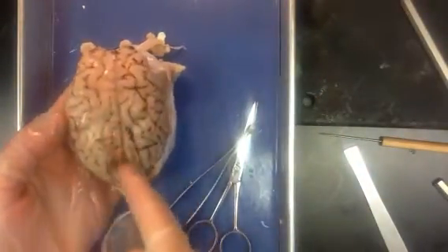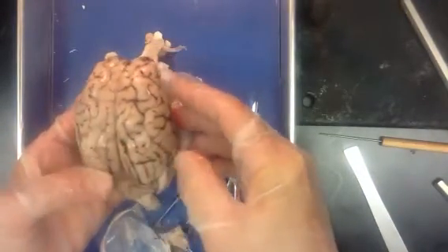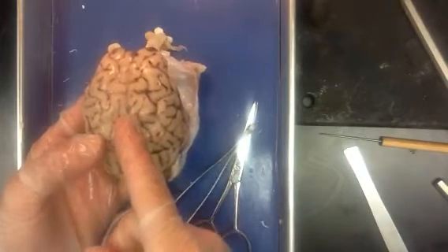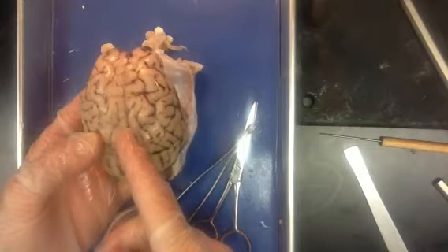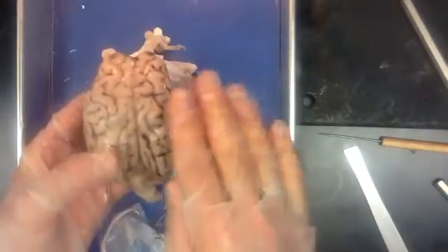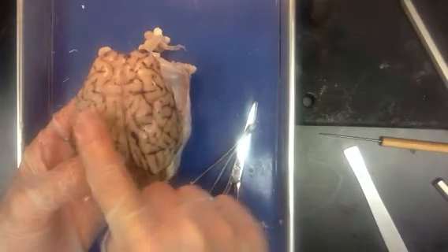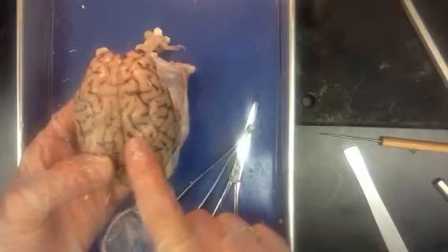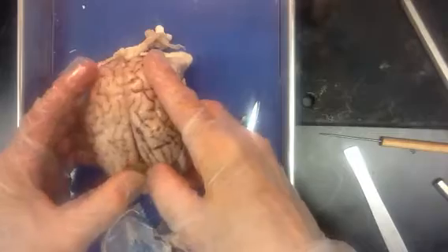The major groove that divides this longitudinally is called the longitudinal fissure. We're going to cut through that here shortly so we can take a look at things. Sometimes it is described as the commissural fissure, C-O-M-M-I-S-U-R-A-L, because it is the crack just above the bridge between the right and the left hemispheres, and a commissure is a bridge or connection of white matter tracts or fibers that connect across the brain. So this goes down and stops right where we have the crossroads that go through there, the commissures.